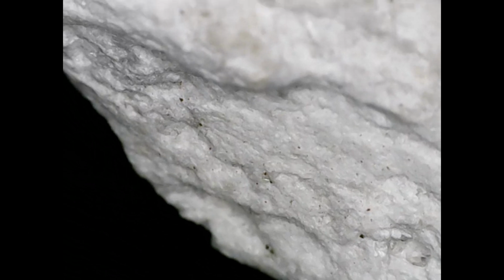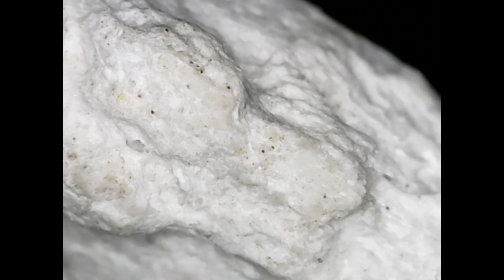So I specifically added this section straight after the perlite section because they look like very similar materials under the microscope, but you can see there's a slight difference. This is almost like unrefined kind of marble, so it's got some pitting in it, but it wasn't quite as fluffy as you might get with the perlite. But you can still see again all of those grooves, all of those nooks and crannies where the water can kind of sit in and it can pull up from.